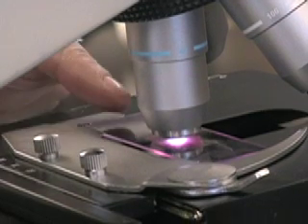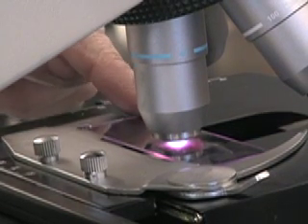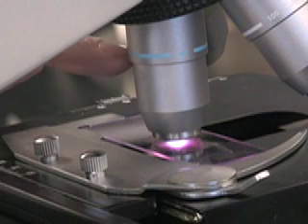We currently have our slide focused with a total magnification of 400 times at the 40X objective.